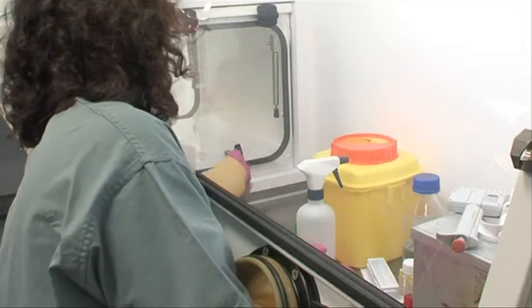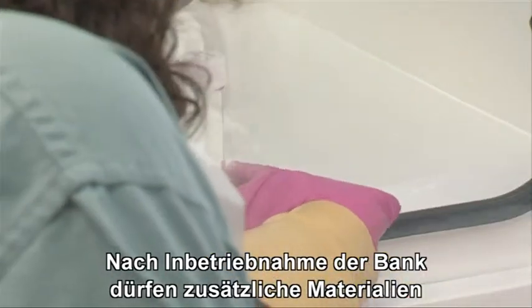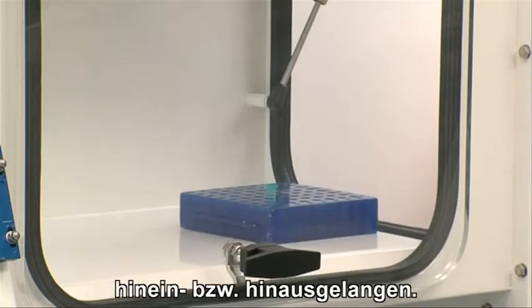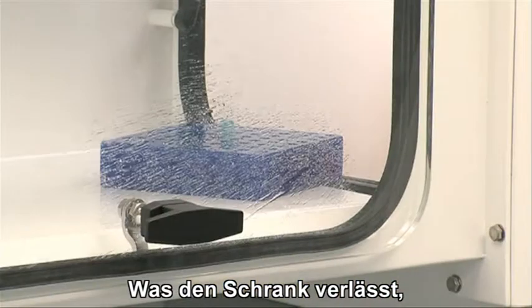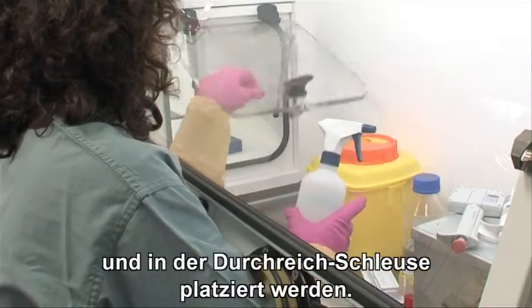Once the cabinet is in use, all materials you're going to need must enter and exit the cabinet via the pass hatch, following the appropriate protocol. All materials that exit the cabinet must be surface decontaminated and placed in the pass hatch.